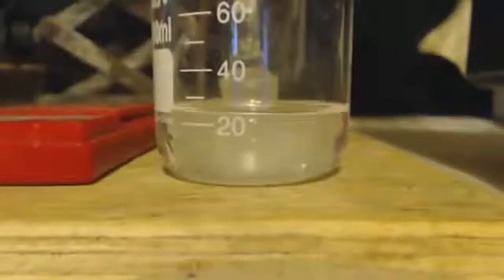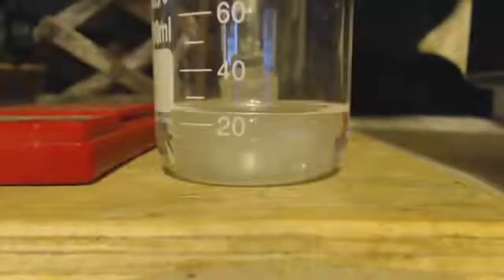So anyways, here's my product, I'm taking out the bottom layer. And it's still going to have trace amounts of water, so I'm going to get some anhydrous magnesium sulfate, I'm going to toss it in there, I'm going to stir it up a little bit and let it sit 20, 30 minutes until it's clear. As you can see, I got 26 milliliters is my yield. That's a 70% yield because 37 milliliters is the theoretical yield. So I got a 70% yield. It's my second try, so it wasn't bad, although I should be better.